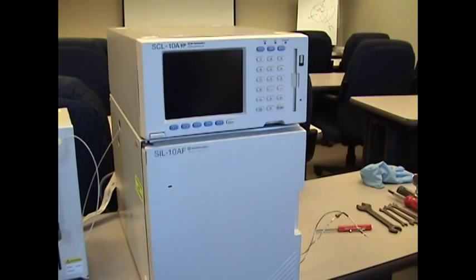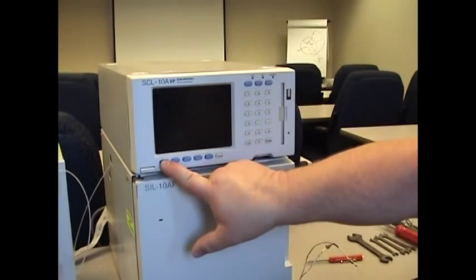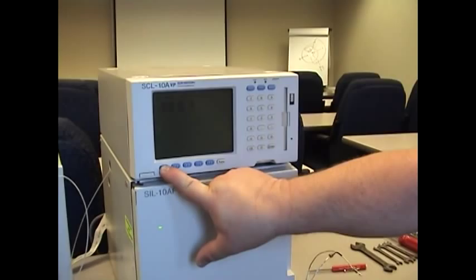You start by pressing F1 with the unit powered off and you hit power. This will put it into a service mode. Release it after a few seconds.